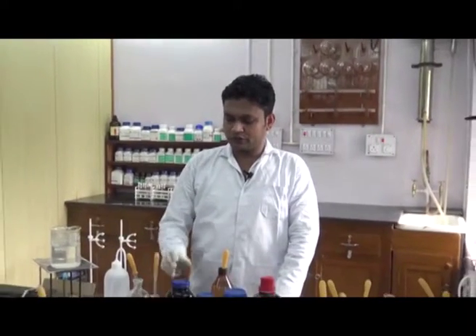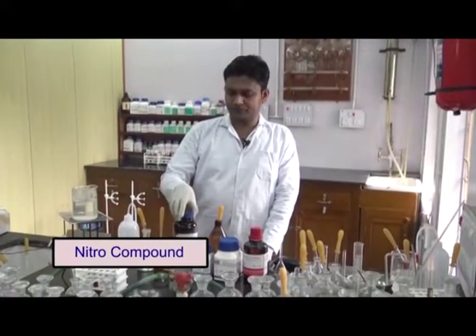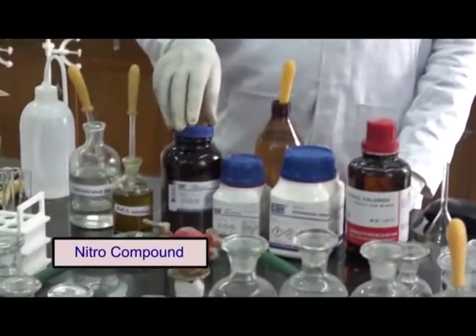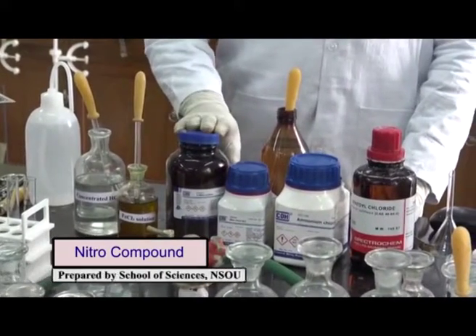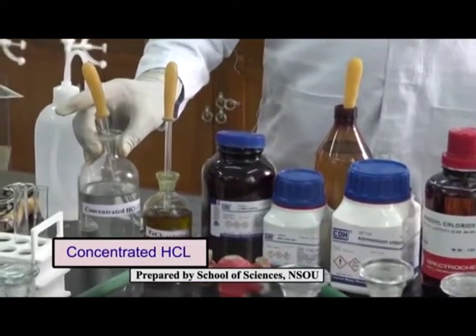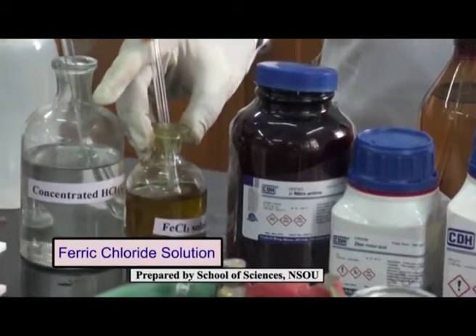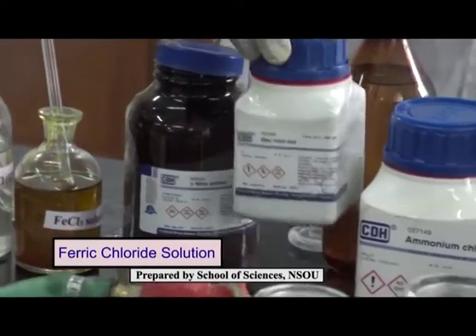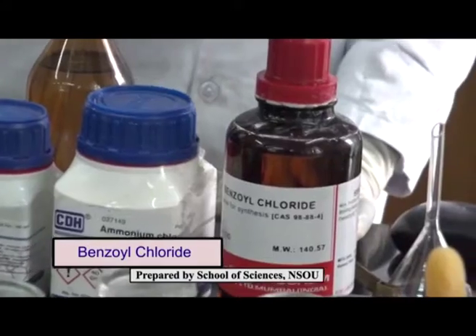Now for the test of nitro group, we will perform the Mulliken-Barker test. For this reaction, we need a nitro compound. It may or may not be in the presence of an amine group. It may be an aliphatic nitro compound or aromatic nitro compound. Both give a positive result in this test. With this compound, we need concentrated HCl, ferric chloride solution, zinc dust, ammonium chloride, and benzoyl chloride solution.